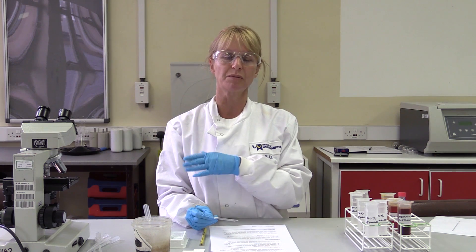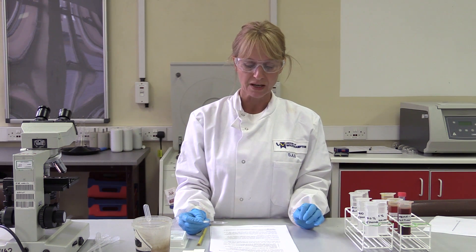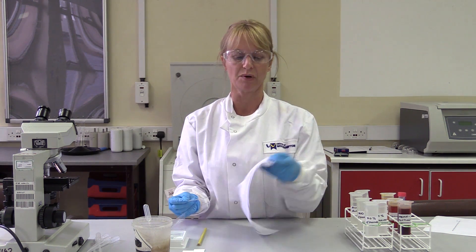Normally in the lab this process would be automated — you'd just put the slide on, it would go through the staining process, and you'd take it off at the end. However, it's important to know what each stage does, because if anything goes wrong with the staining, it's the biomedical scientist's role to be able to rectify it. If they don't know what the stain does, they can't fix it. So each stage is for you to understand what the stain is doing, and you'll be recording what you see down the microscope.